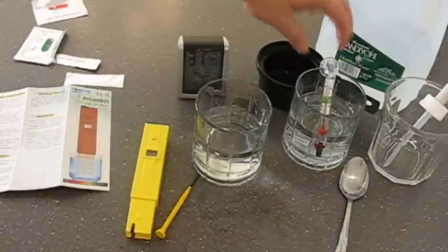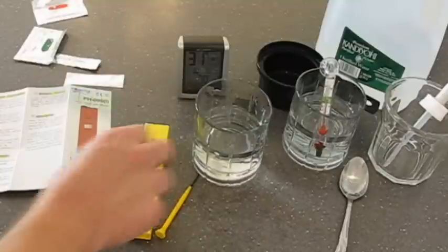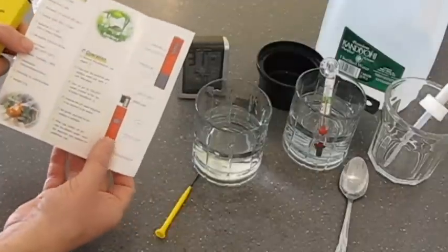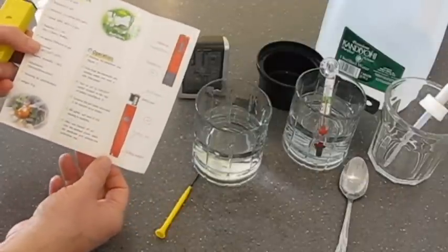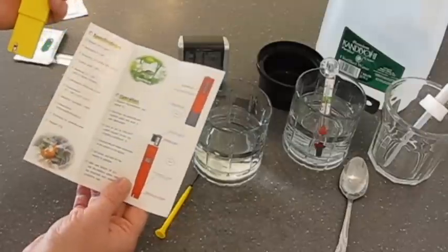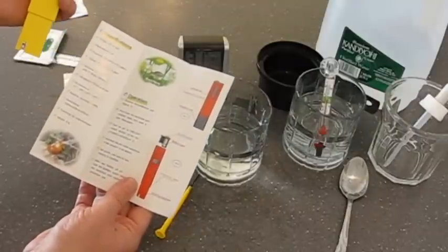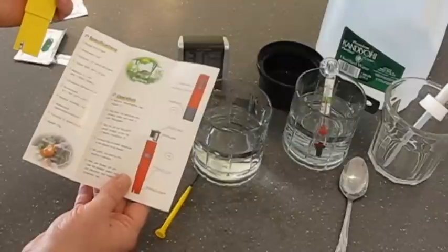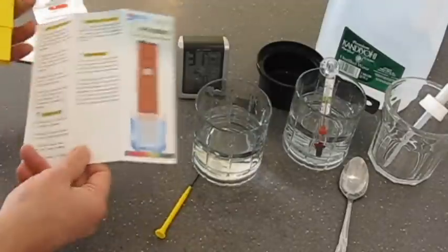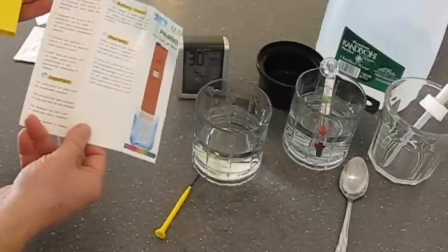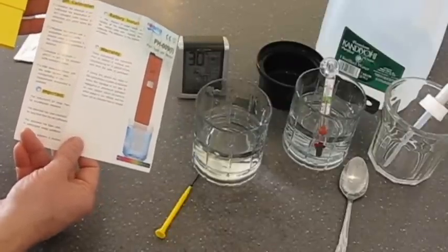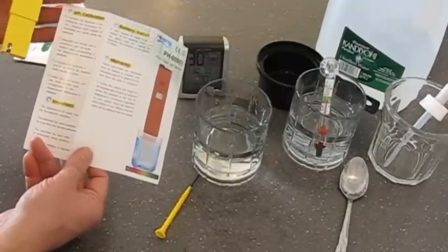Okay, my temperature is still pretty close to 77 degrees. And so I'll just read the instructions here. Remove the protective cap, rinse the electrode with distilled water, which I've already done. Turn it on, which is this little switch here. Immerse the pH electrode in the solution to be tested, gently stir and wait for a reading to stabilize. After which, switch off the pH, use distilled water to clean it. But that's normal use. In the calibration process, you immerse the electrode in the 6.86 first at a temperature of 25 degrees Celsius or 77 degrees Fahrenheit, and gently shake the electrode.